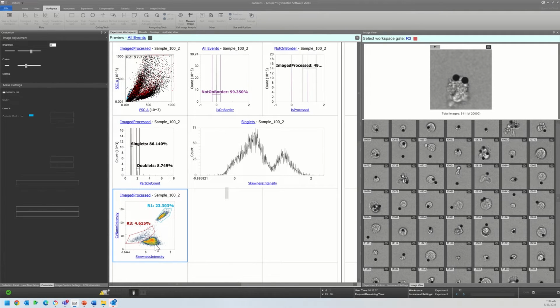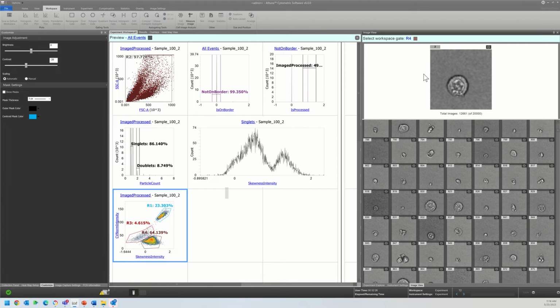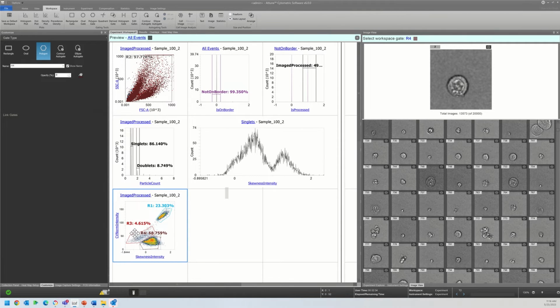And so then this population down here is going to be our cells and debris, dead and dying events. And we know that this is the group that we're more interested in resolving and in removing the debris and dead and dying events for a final cell count. So I'm just going to name these really quickly because these give us a really good opportunity to use some of these other parameters.